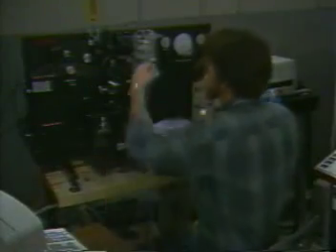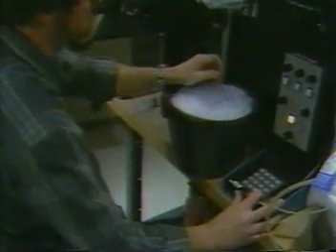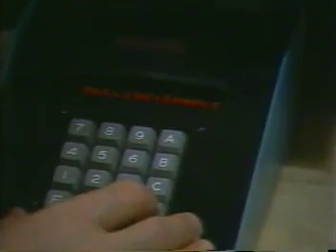Before we explore these analysis options, let's take a closer look at what Keith does to collect data for a sample. Right now, he's using the BD Rapid Sampler to deliver the contents of sample well F1 to the analytic stream.